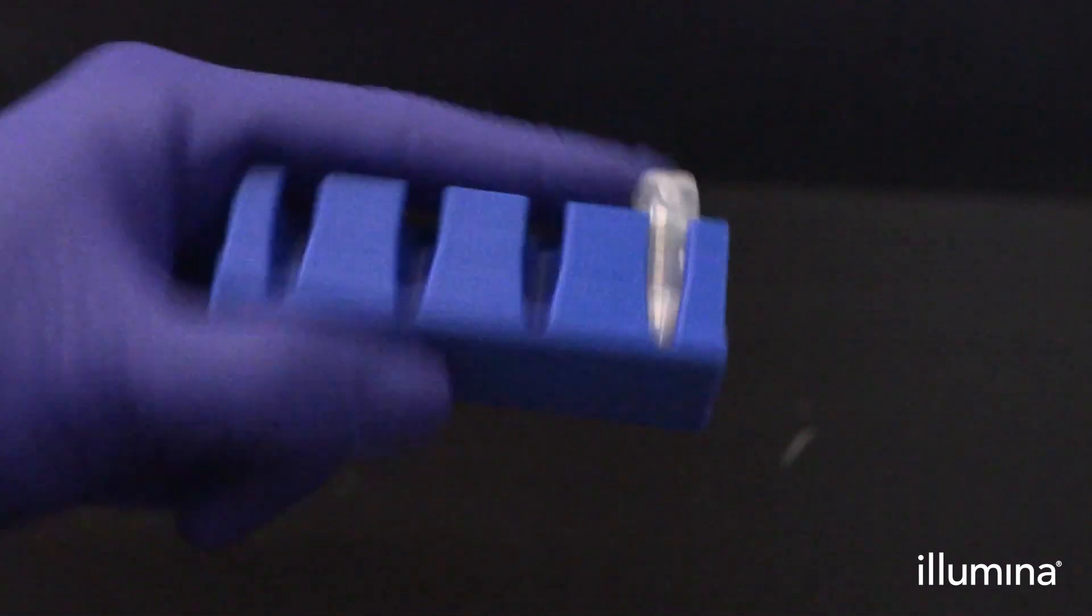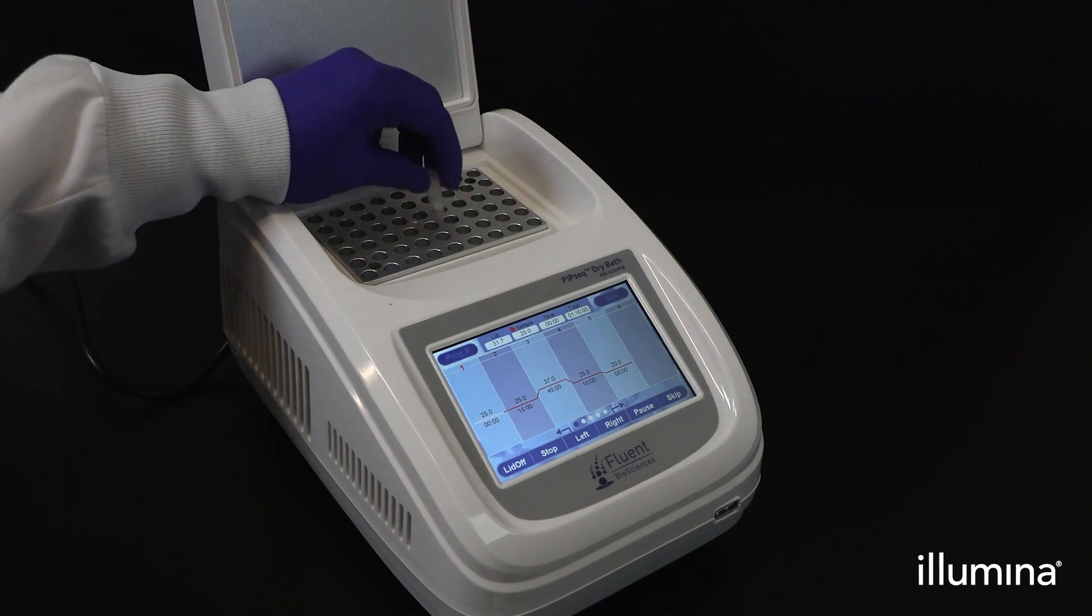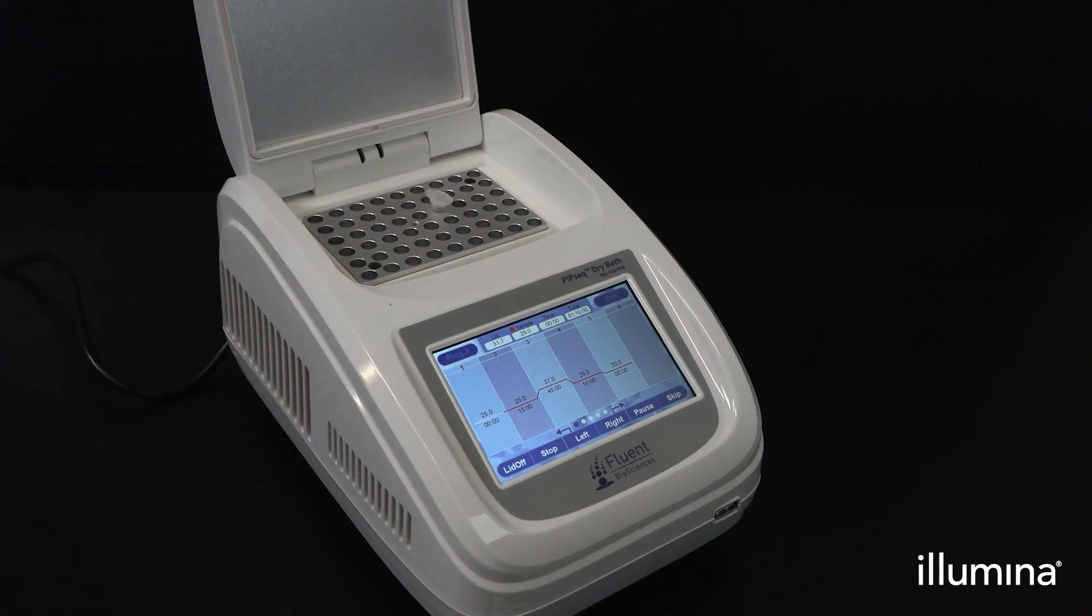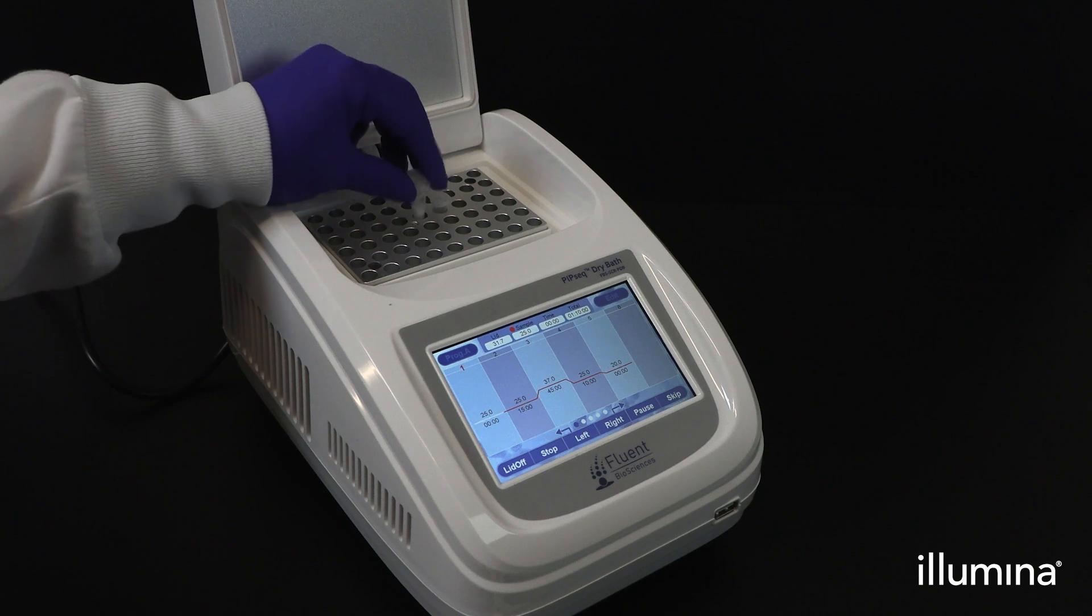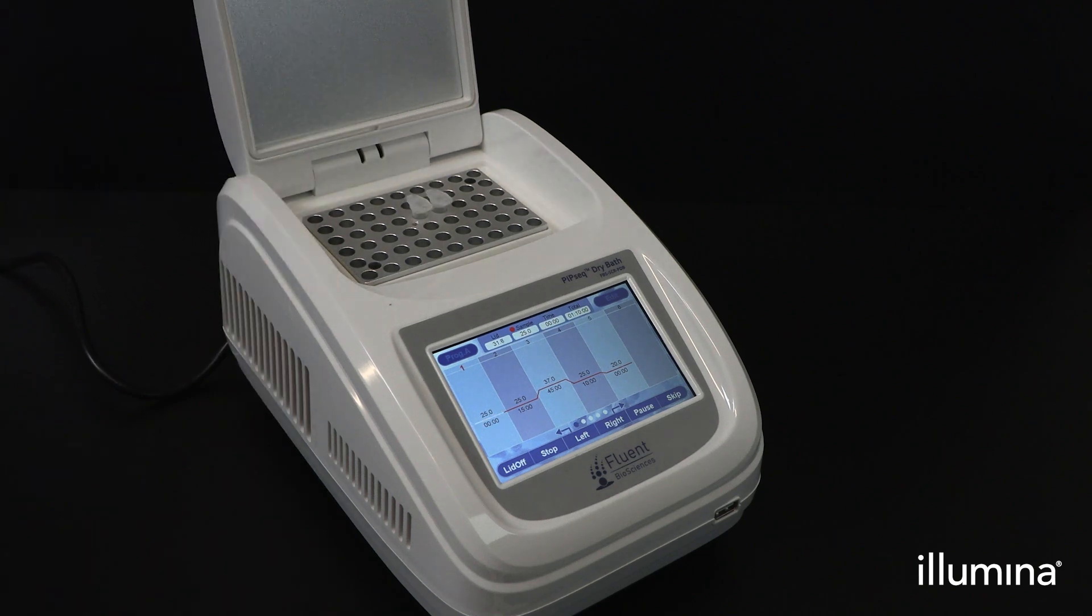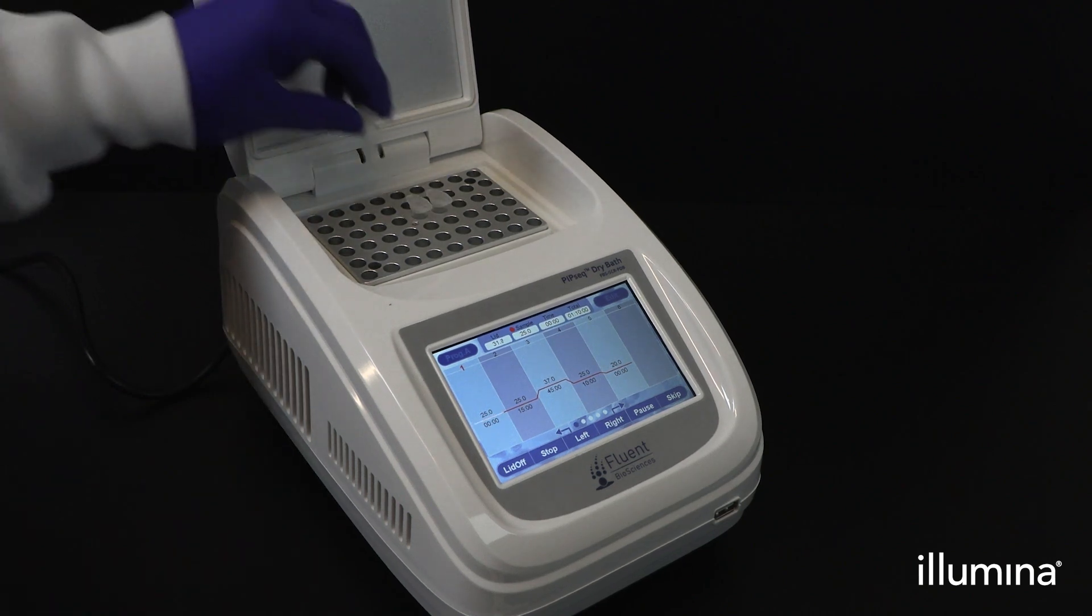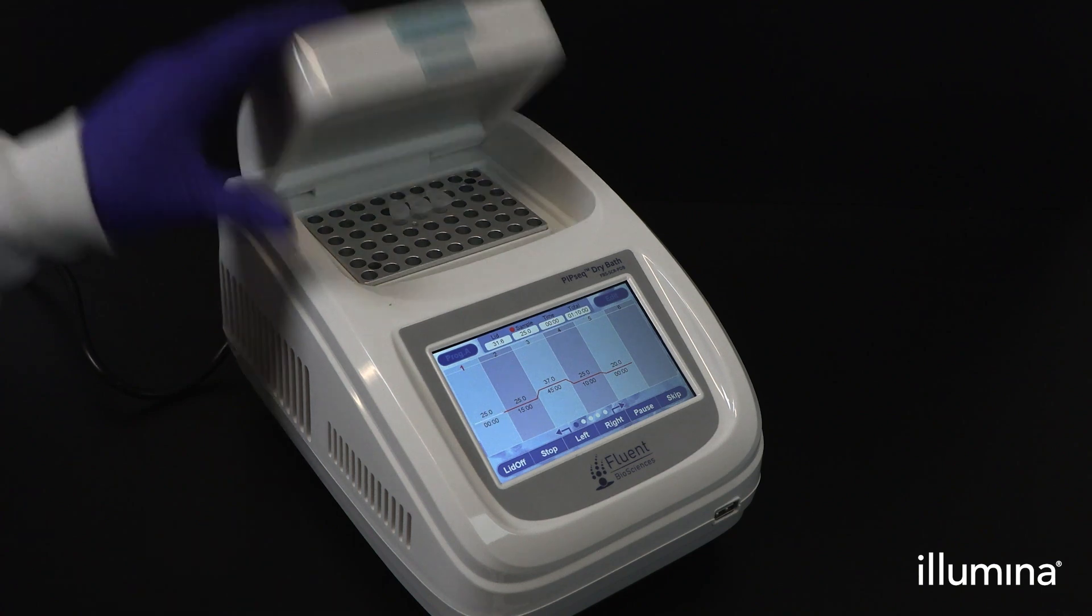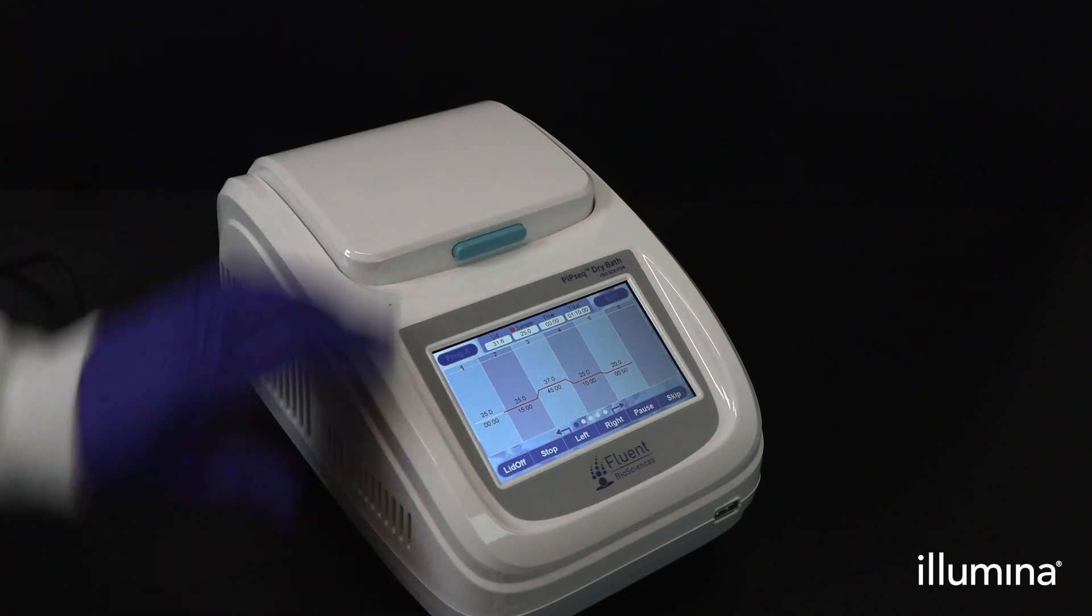Verify the PIP-seq dry bath is preheated to the appropriate temperature for your sample type. Then, insert the samples into the dry bath and select skip and yes to begin lysis incubation. Please refer to the user guide for the cell and nuclei lysis temperature profiles for this step.